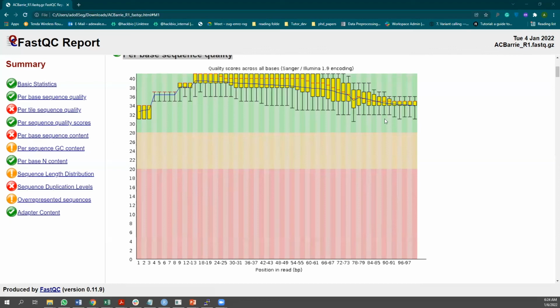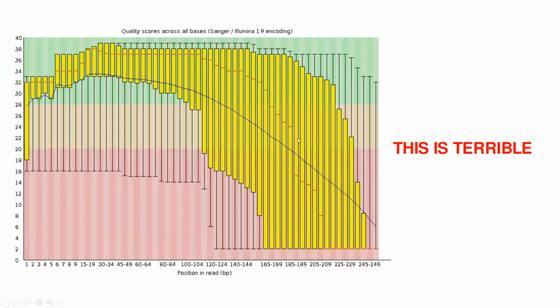but for instance, you may have some terrible plots, and I can show you what really looks terrible. This is very terrible, right? A lot of the sequences are falling into the red region, and you can also see that sequences after the 100 base pair region in each fragment have poor quality scores. So that can give you an idea of how to prepare your library as well. Your library can be in the range of 100 base pairs. Some people have been able to publish very good results with 150 base pairs as well. Okay. Then the next thing is the per tile sequence quality score.